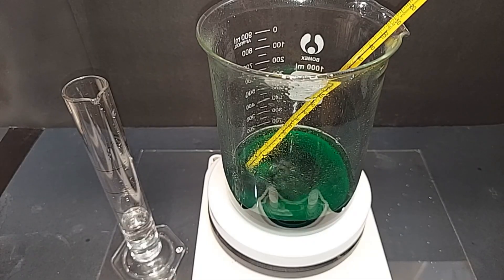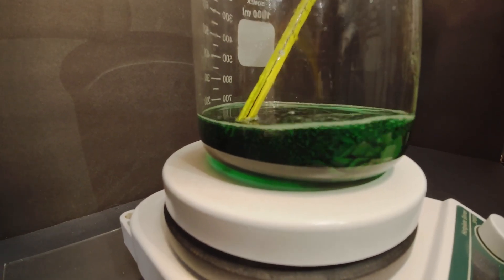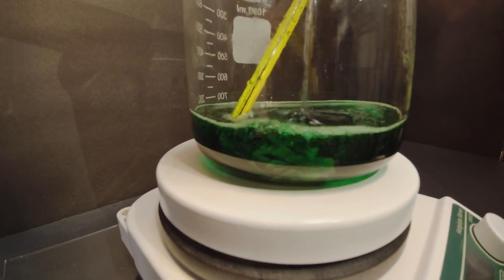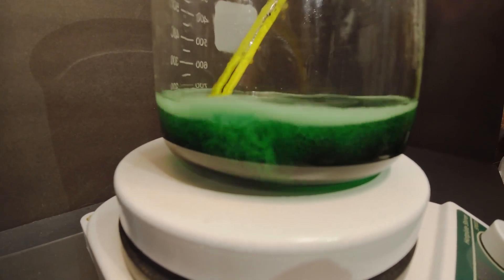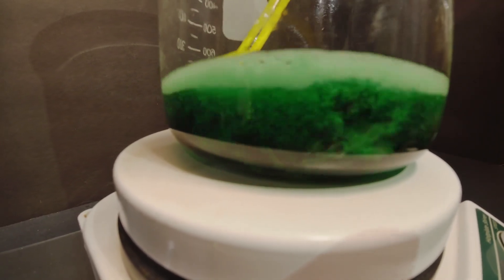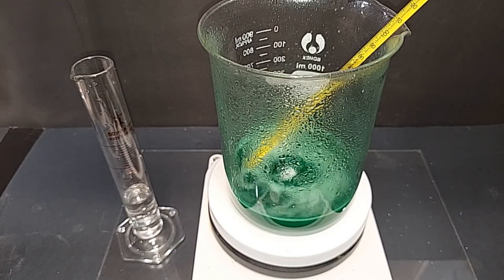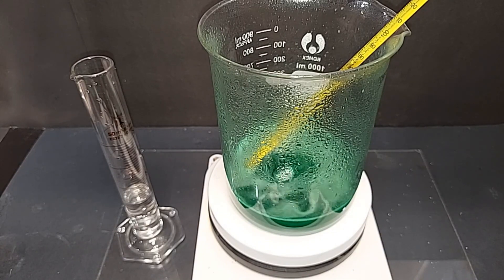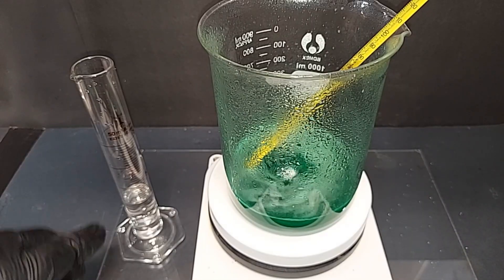Okay, it's calmed down quite a bit. I will continue to add the hydrogen peroxide slowly. There's quite a bit of metal still - I'm kind of seeing a darker area in the middle there, that's all still the metal chips. I was able to start using the magnetic stir pretty aggressively there. The temperature right now is 76 degrees Celsius and I've added 80 milliliters so far of the 30% hydrogen peroxide. I used up the first 50, filled it again and used up another 30.